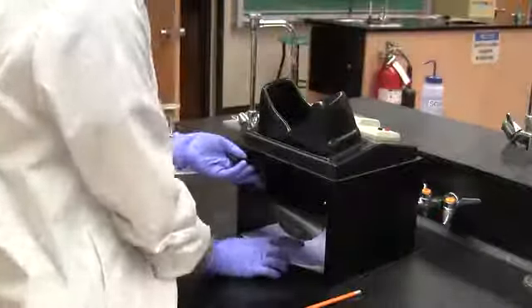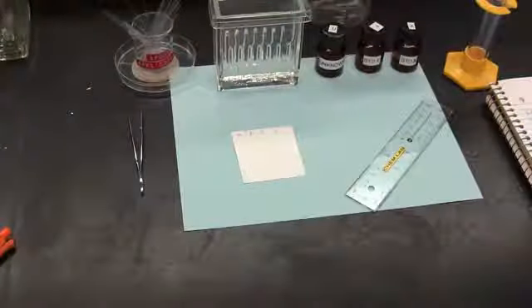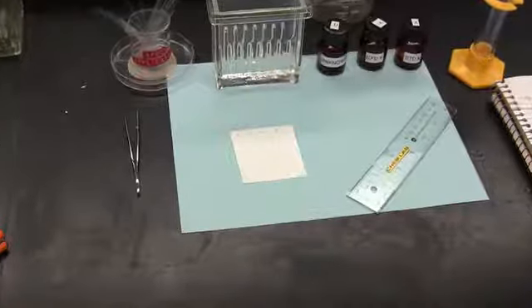So while visualizing the plate under UV, we're now able to outline all the spots with a pencil so that we can locate the spots under visible light. And once all the spots are outlined, we can remove the plate from the UV light box. And now that the plate is no longer under UV light, we can see all the spots together with the solvent front. Let's take a closer look at the results.